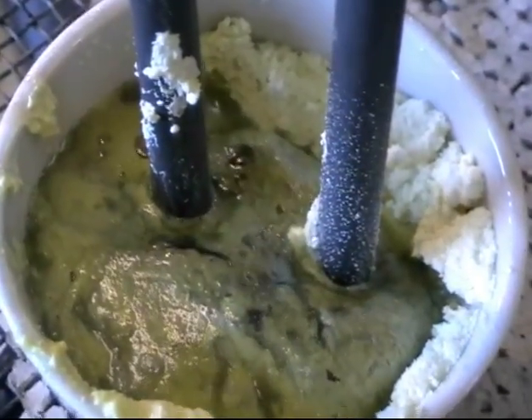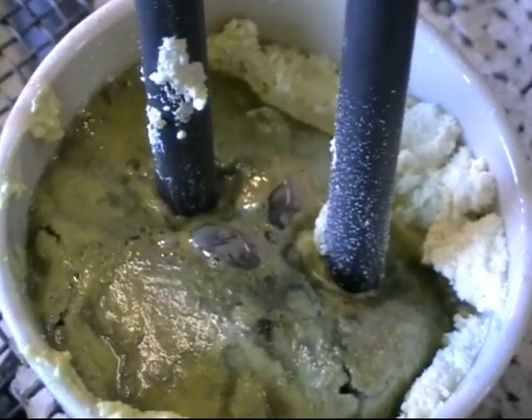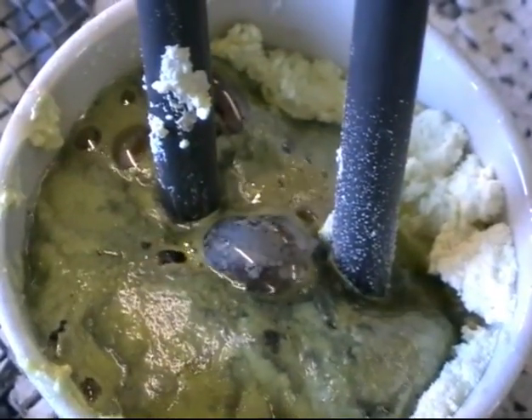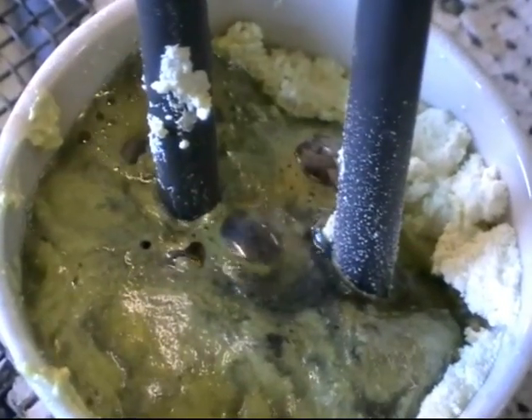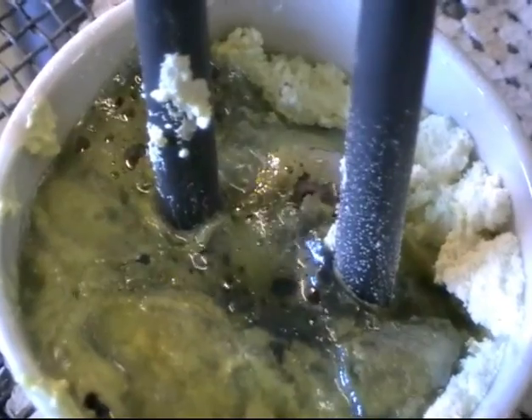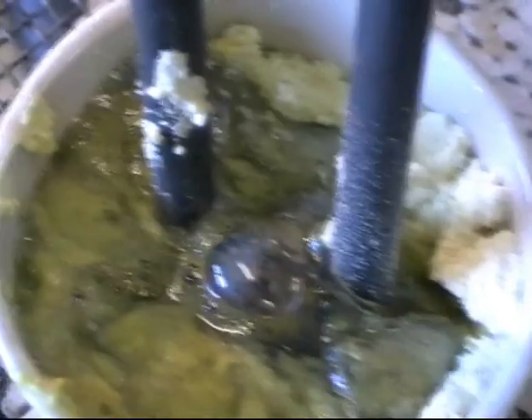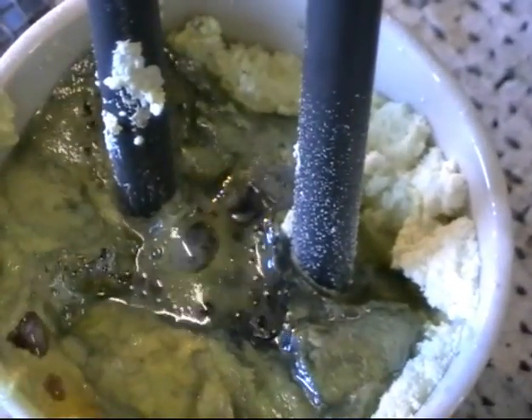This needs to be done in a fume cupboard. There's no such bubbling immediately around the right hand electrode — that's where we're getting the lead produced. In a few moments I'll withdraw the electrodes, hoping to see some signs that lead has been produced around the right hand electrode, the cathode.